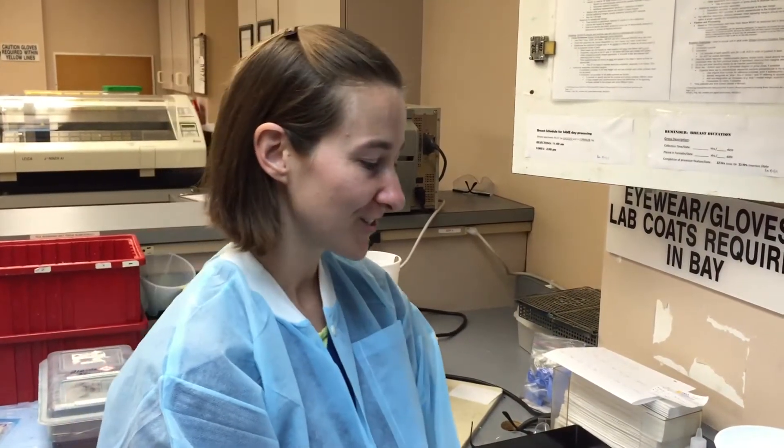Hello, my name is Summer Blount and I am going to do a three-part demonstration on how to gross a breast at the FMO.